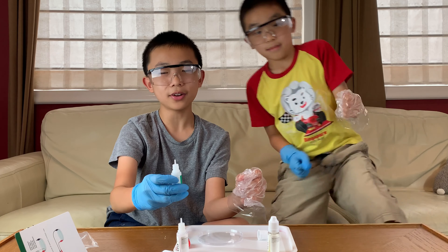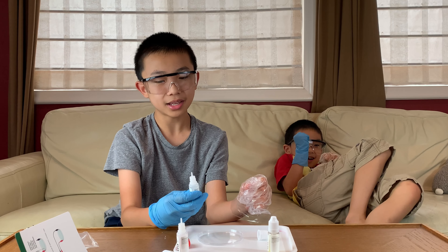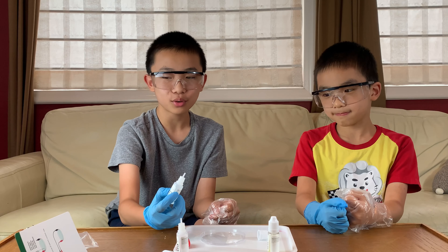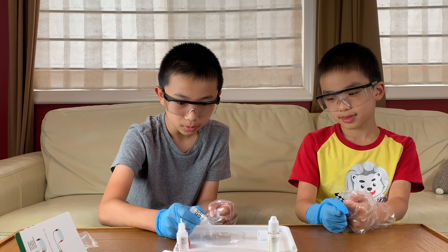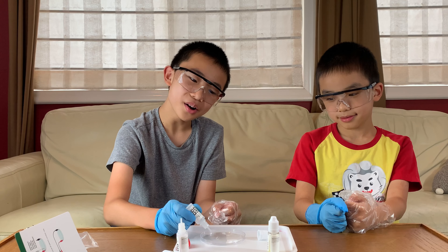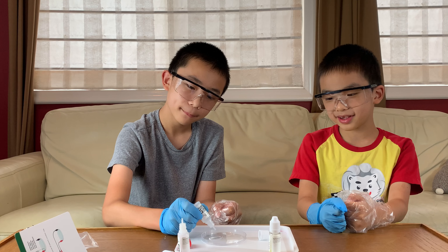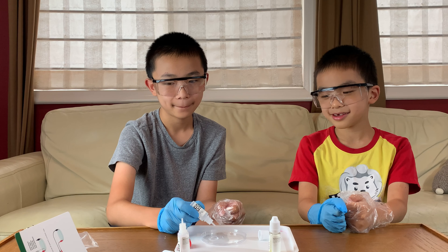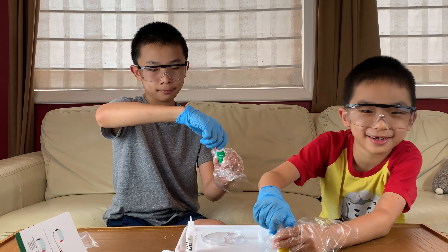So we have this bottle of two toxic liquids: tin chloride and sodium hydrogen sulfate. Pouring the liquid into the petri dish — whoa, that's a big sphere! It just became one circle. Now we put in the liquid soap, which is also toxic. Only two drops.